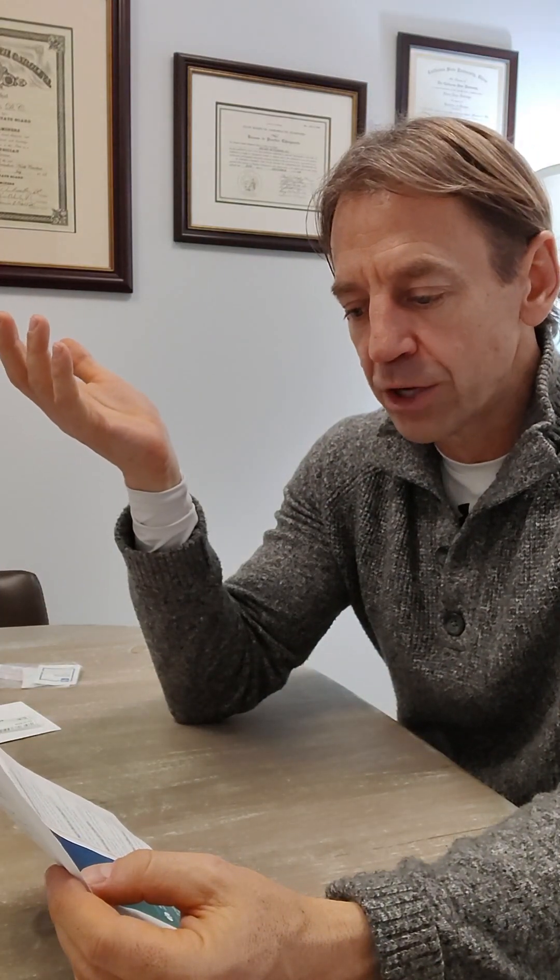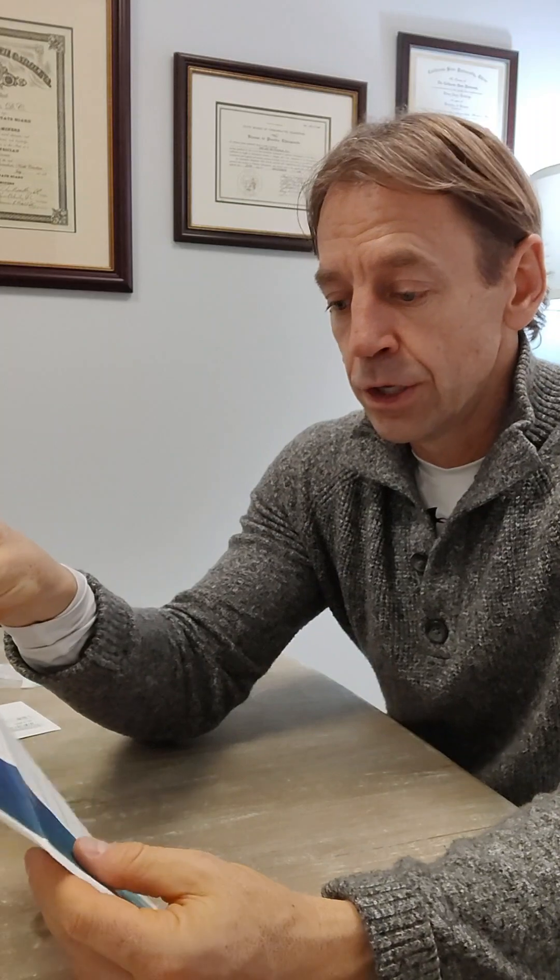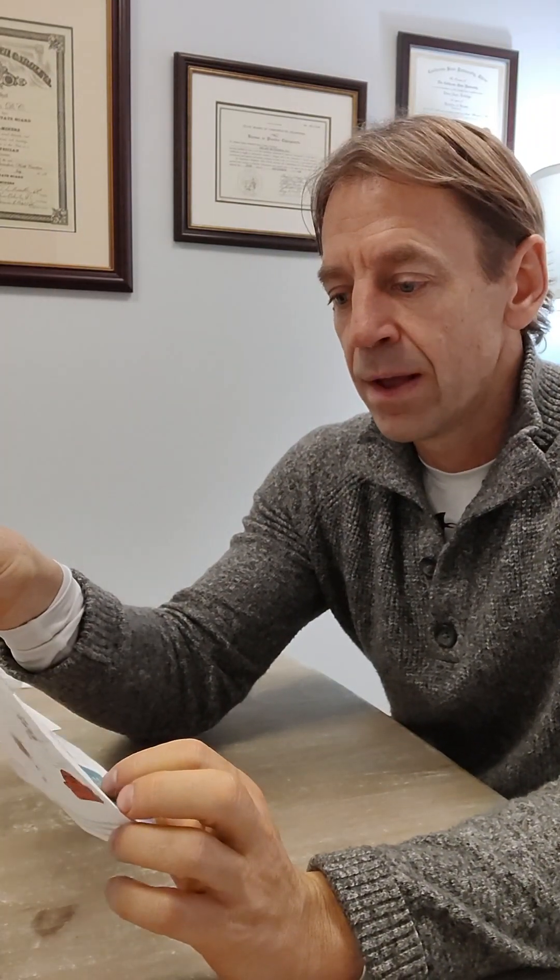Let's go through some rules before you actually begin doing this test. Make sure that freezer brick is frozen. Make sure that you are on a usual diet, and make sure that you don't drink any more than six eight-ounce glasses of fluid — that's 48 ounces — the day before you do this test. You're going to fast overnight; if you wake up in the middle of the night, you're not allowed to eat or grab a snack — only water. On the day of collection, you're allowed to brush and floss your teeth, but do not use mouthwash. No mouthwash — you're going to be swabbing the inside of your mouth and that will affect the results.